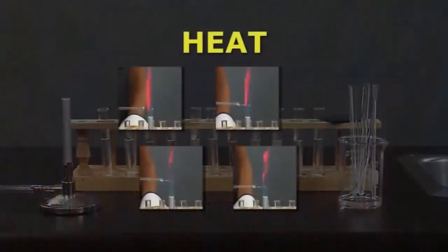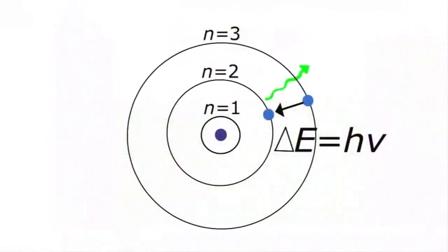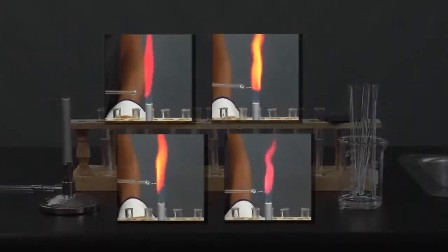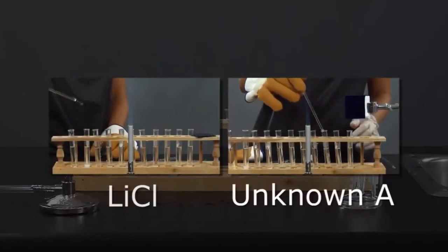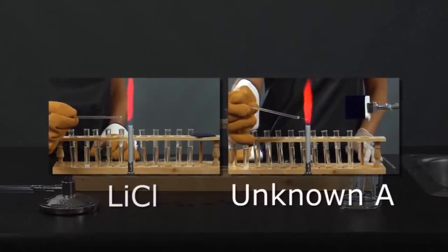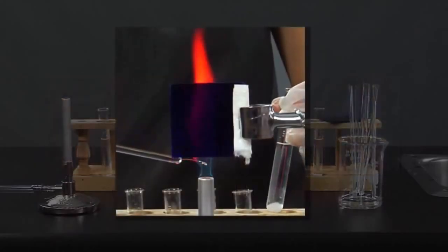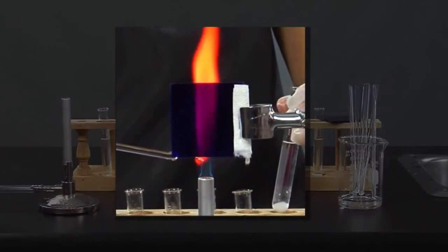In conclusion, we have used heat to excite electrons from metals in families 1 and 2 and cause them to jump energy levels, radiating the excess energy back in the form of light. This light exhibited a particular color. By comparing the colors produced in the flames of the known substances to those that are unknown, we can identify the metals present in the latter. We also learned that these colors belong to specific atoms. It is now time for you to complete your lab report.